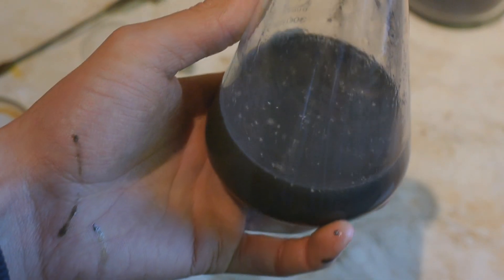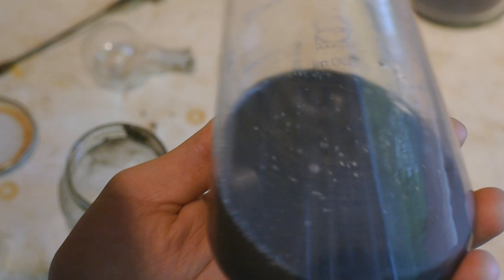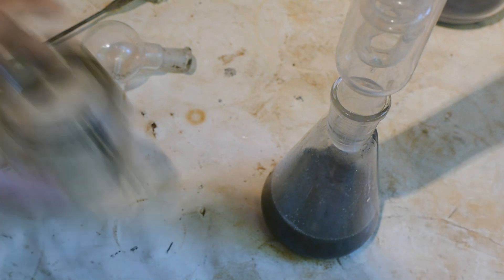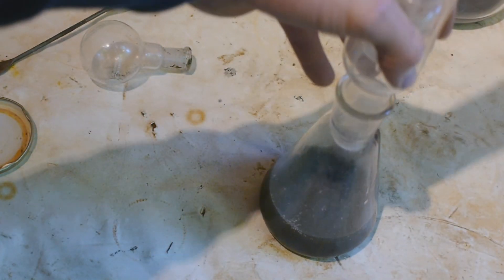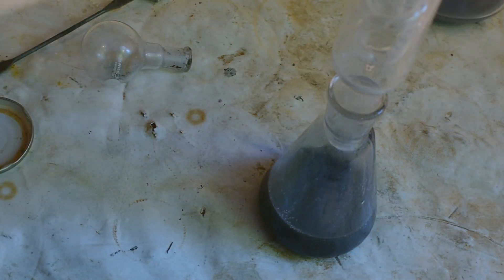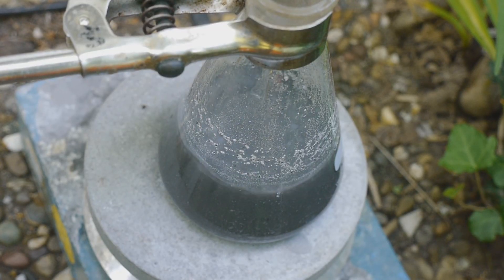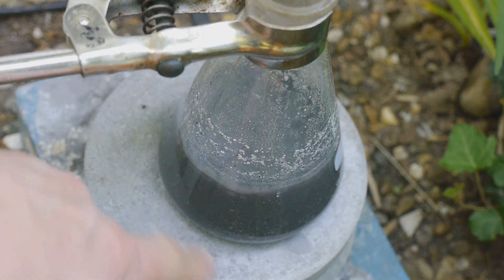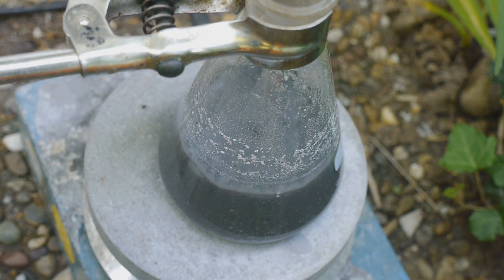Something's swimming on the surface. Is that sodium already? Could be that the larger beads of sodium are already swimming up. It's interesting. And now boil it and pray to god we get a decent amount of sodium out of this. This has been refluxing like this for more than half an hour and I'm not seeing anything. Maybe some sodium has collected under the surface and I can't see it. So we'll turn off the heat. And if it cools down it should float up. But we'll have to see with that.